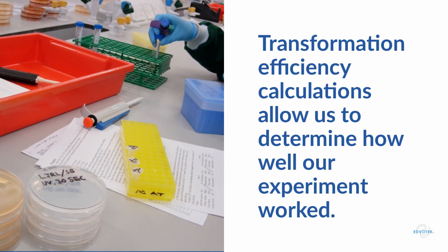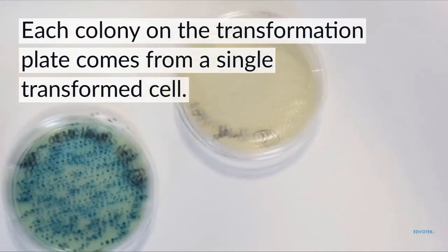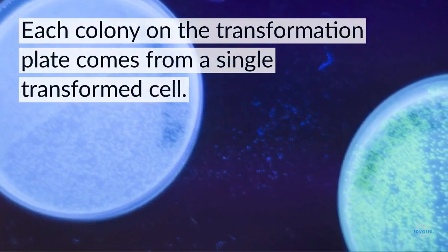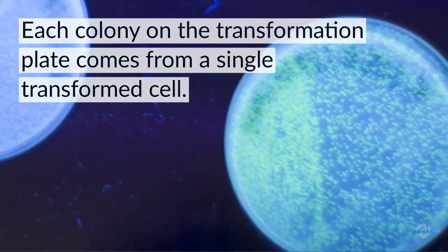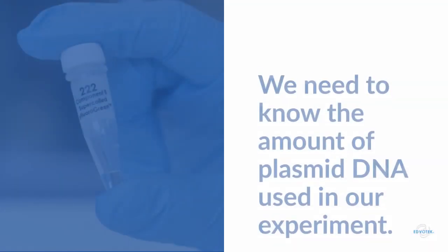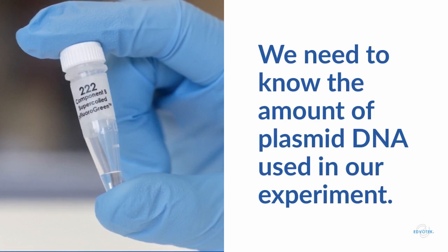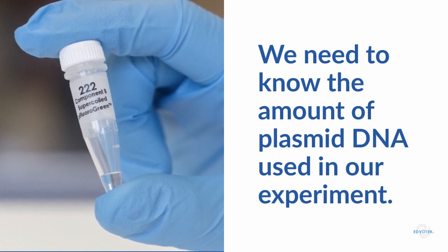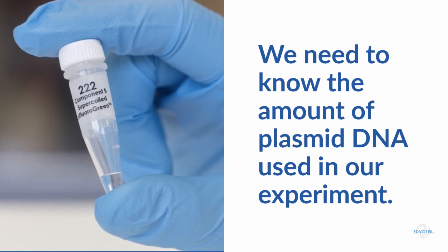We can use the data from our experiment to determine how well our transformation worked. Because each colony growing on our nutrient agar originates from a single transformed cell, we can calculate the number of cells transformed per microgram of plasmid DNA. This is the transformation efficiency. To calculate it, we first need the amount of plasmid used in the transformation in micrograms. A common amount is 10 nanograms, or 0.01 micrograms.